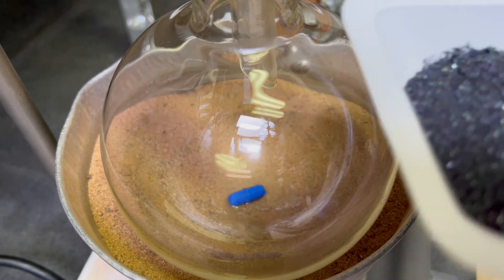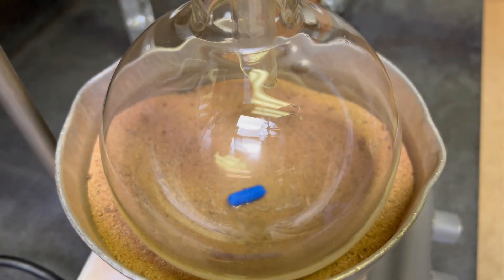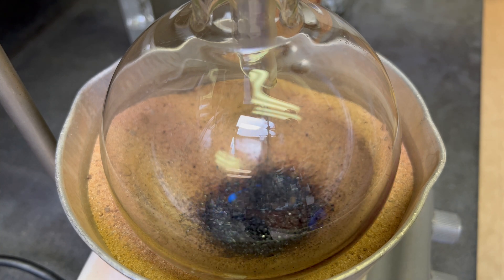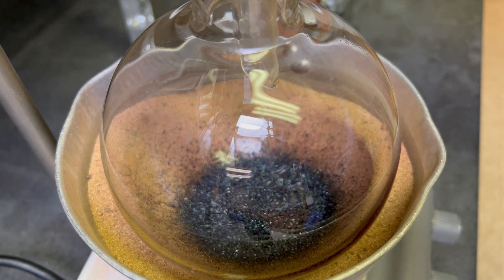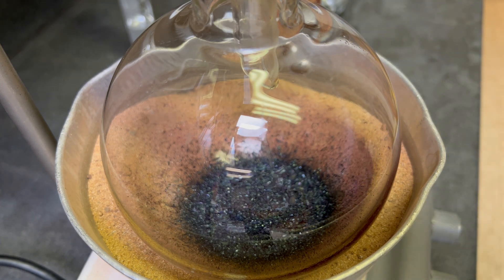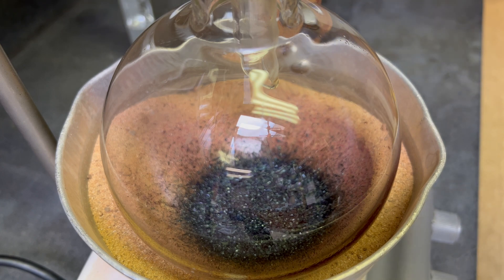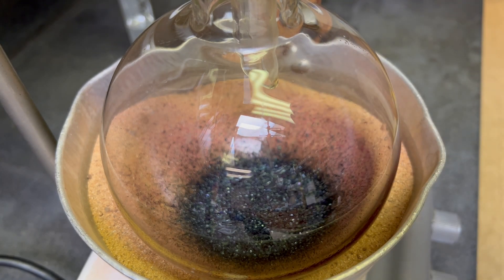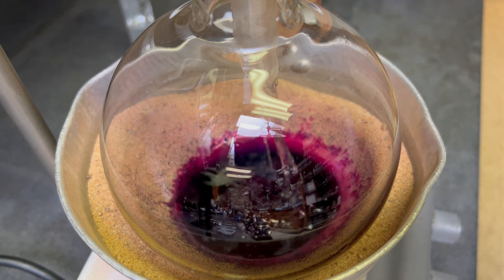First, add 45 grams of potassium permanganate into the reaction vessel in which a stir bar is. Then a solution of 2 grams of potassium hydroxide in 500 milliliters of water is added to the flask.